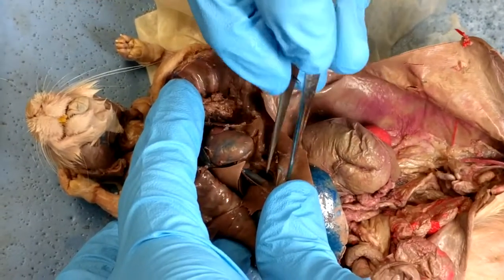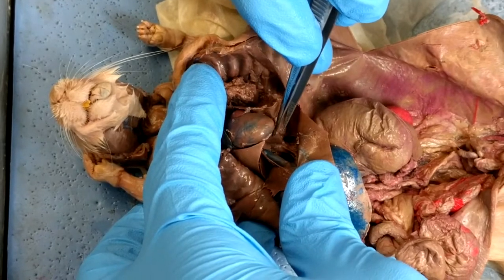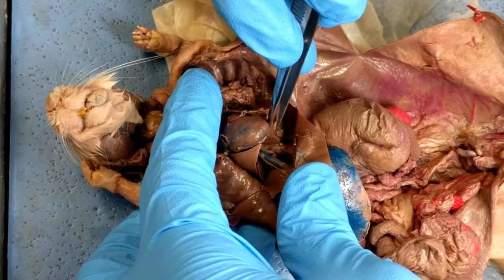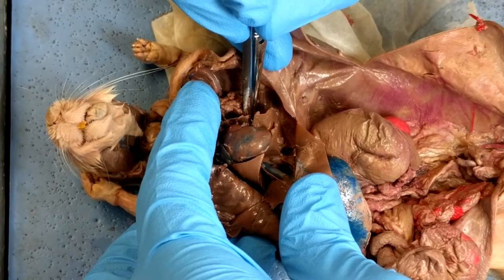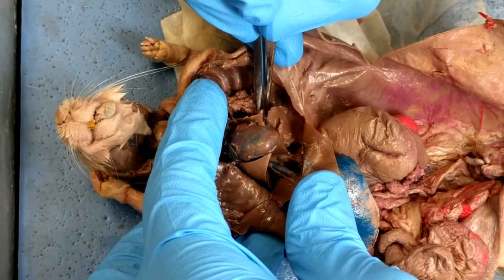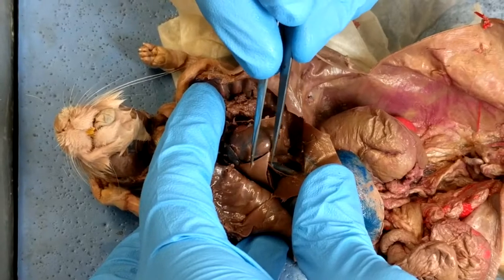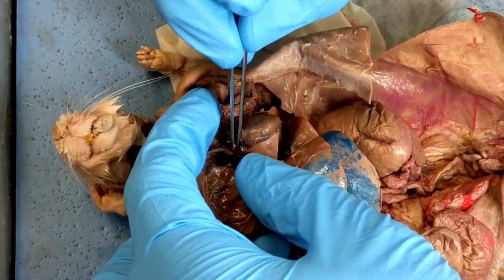If you go straight across from the caudal lobe of the right lung, that's where you find the accessory lobe of the right lung. Even though this one is on the left side, it's still part of the right lung. And then there's only one lobe of the left lung — it's the big one here. So to summarize: left lung, accessory lobe of the right lung, caudal lobe of the right lung, middle lobe of the right lung, and cranial lobe of the right lung.